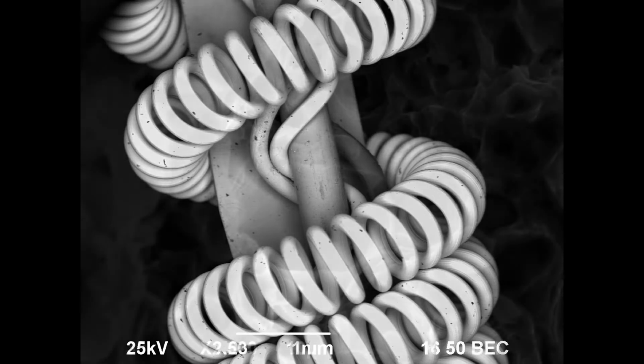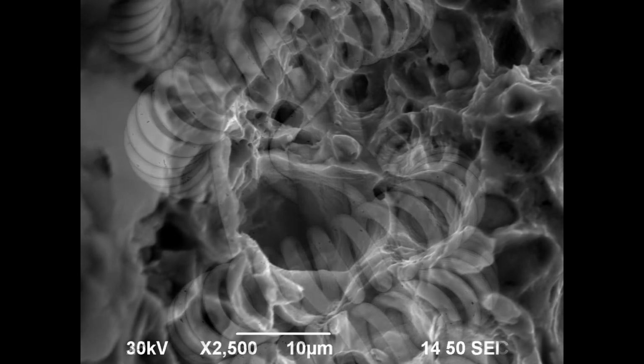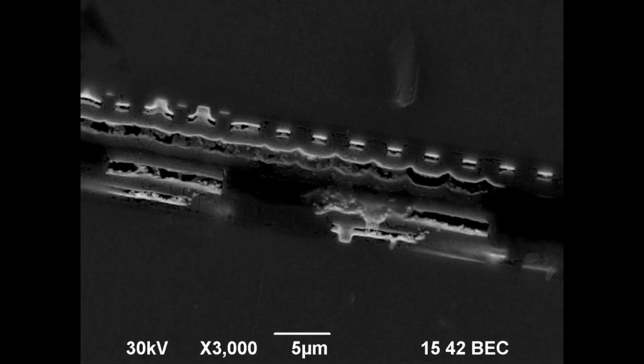Okay, but why does the sample need to be conductive? The first thought might be that non-conductive samples wouldn't lose any electrons from the beam, and that's not too far off from the real reason. The reason samples need to be conductive is they need to have a place to direct the massive amount of electrons from the beam, because if they can't get rid of those electrons, then the sample builds up a negative charge that starts to deflect the position of the beam, ruining the image. In most cases, this can be overcome by coating the sample with a conductive material. The most common ones are carbon, gold, and a gold-palladium alloy.